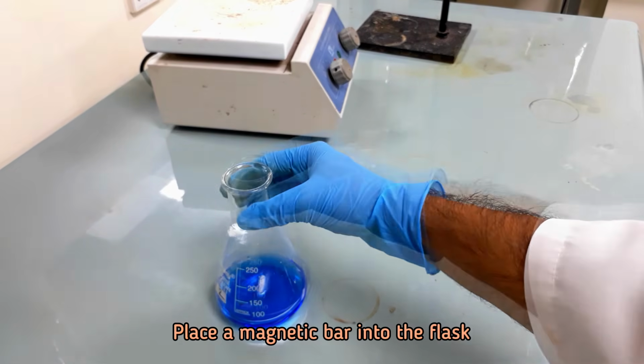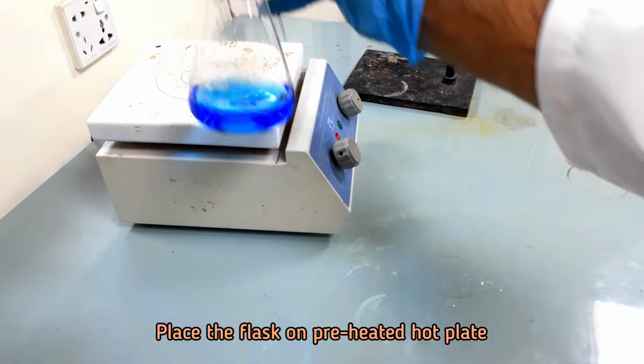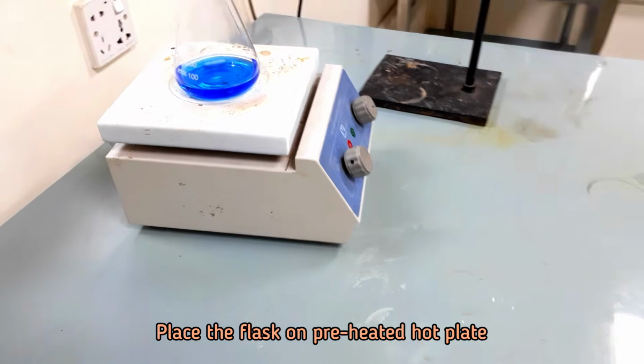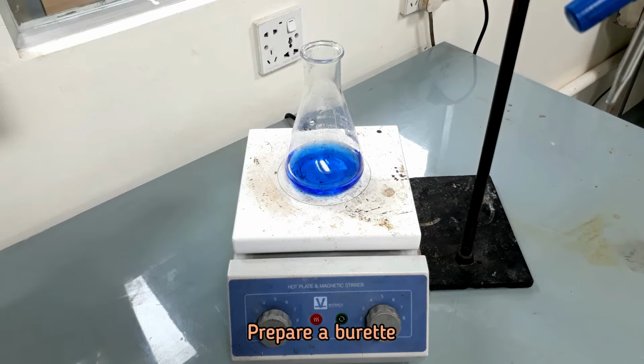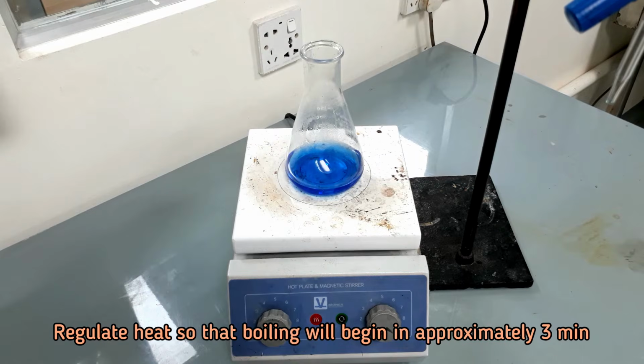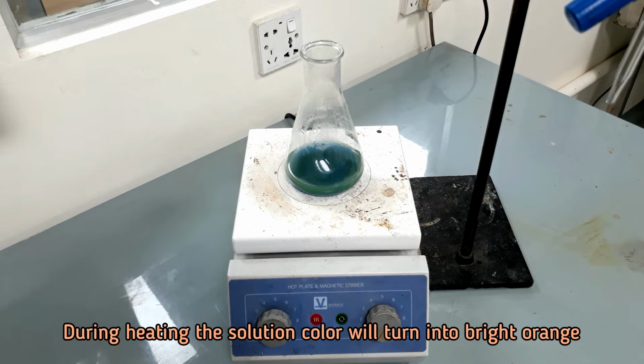Place a magnetic bar into the flask and place the flask on preheated hot plate. During heating, the solution color will change slowly to bright orange.